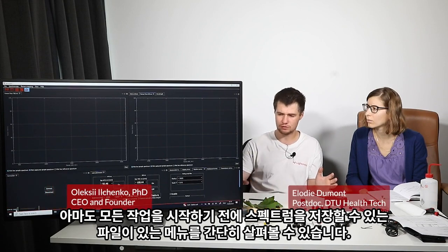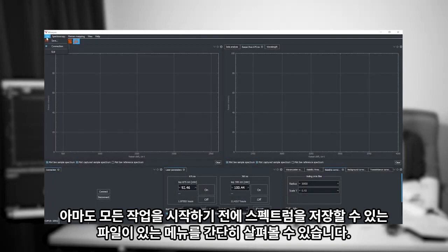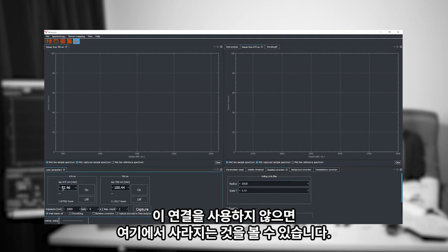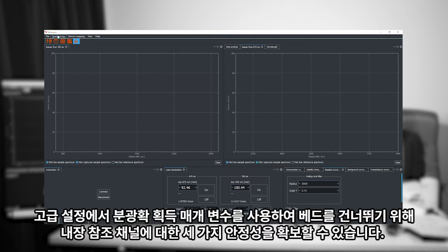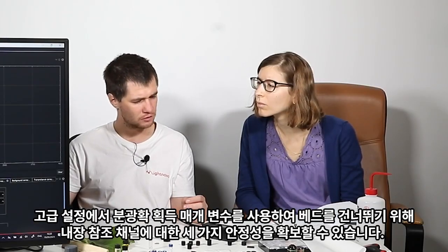Probably, before we start all the operation, I can briefly go through the menu. There is file, we can save spectrum and this connection. If I unuse this connection, you see it disappeared from here. And it happens for all the software windows you have. Then spectroscopy, acquisition parameters. In advanced settings, you would have the threshold stability.